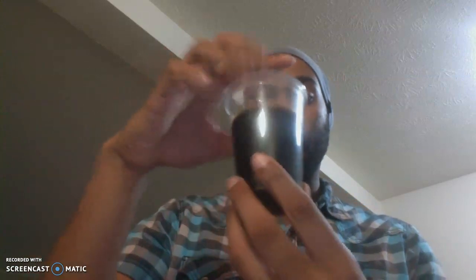Some factors that could affect how fast the rate of this chemical reaction, or any forward and reversible reactions, is the amount of product or reactant that you add, and also temperature. If I were to heat this up, then the solution, as I was stirring it, would have changed faster. It would have turned colors faster.